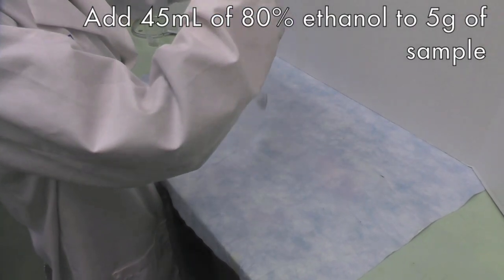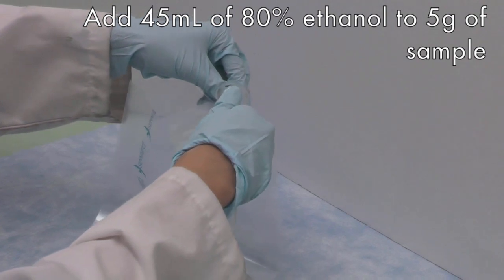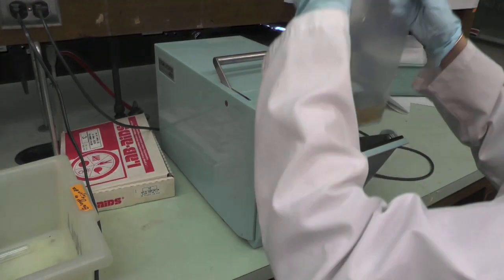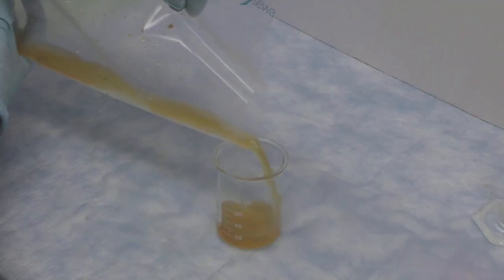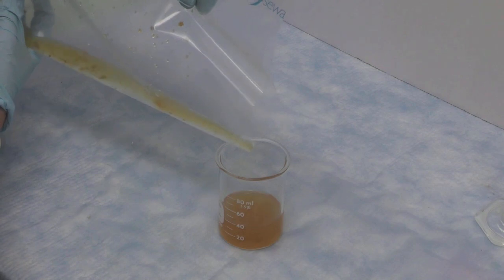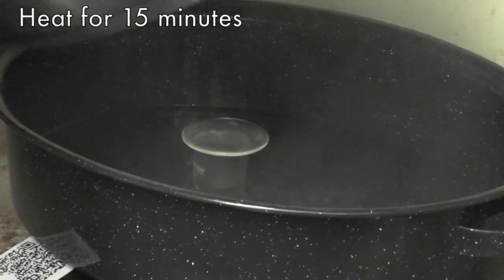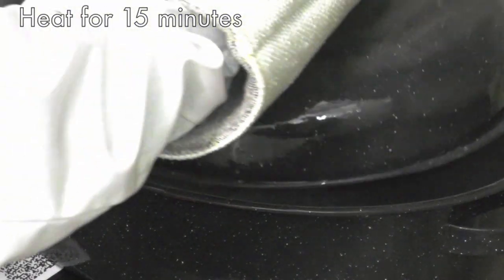Add 5 grams of apple puree and 45 ml of 80% ethanol into the stomacher bag. Blend the mixture using the stomacher and then transfer the solution into a 100 ml beaker. Cover the beaker with a watch glass and then place it in a boiling water bath for 15 minutes.